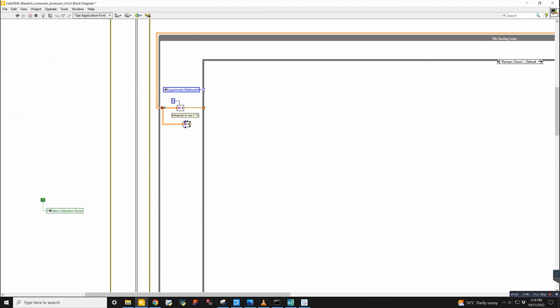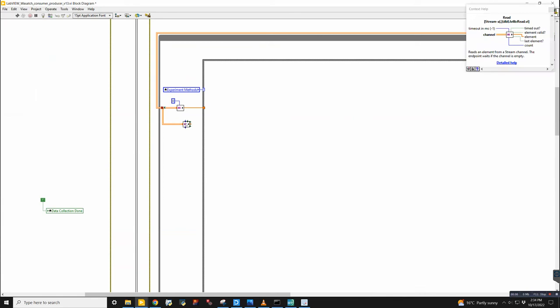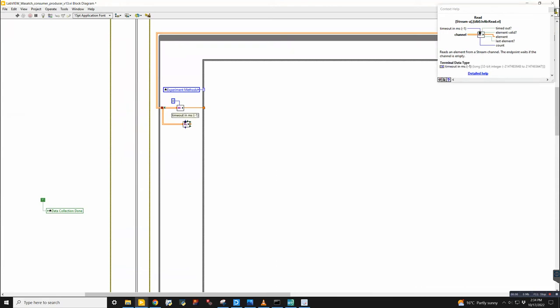But the important thing here is a couple of settings that you actually get from the channel reader. One thing here is the timeout in milliseconds. This is like the event structure where you have to specify a time, and by default, -1 is wired into this slot. That means it will wait indefinitely for data. I find that usually gives hiccups in the code and doesn't work so well. It's better to have a default case in the loop that just does nothing until some data comes in.